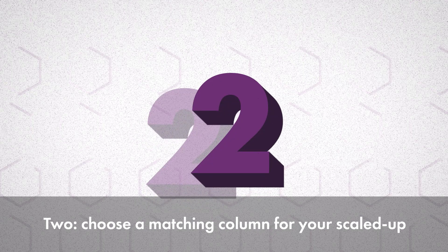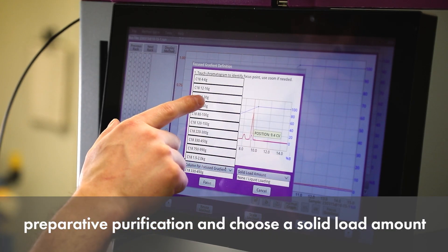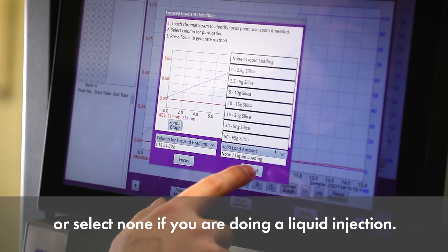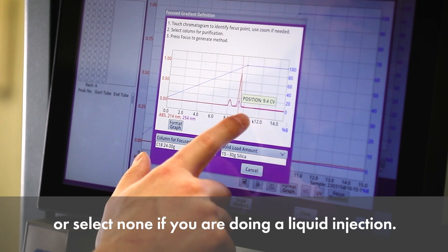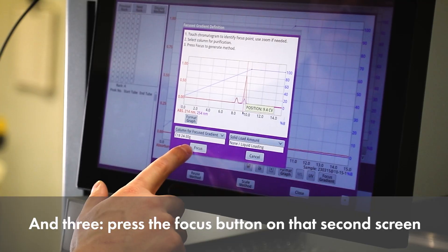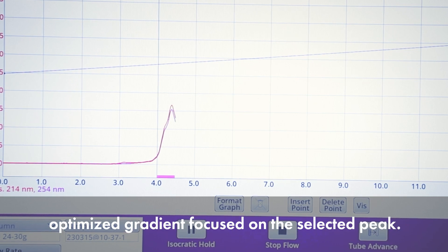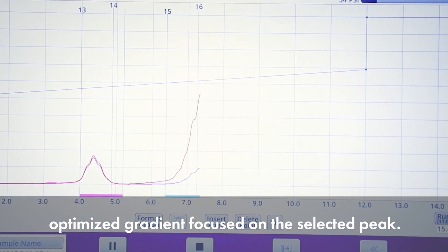Step 2: Choose a matching column for your scaled-up preparative purification and choose a solid load amount, or select None if you are doing a liquid injection. Step 3: Press the Focus button on that second screen and the NextGen automatically generates an optimized gradient focused on the selected peak.